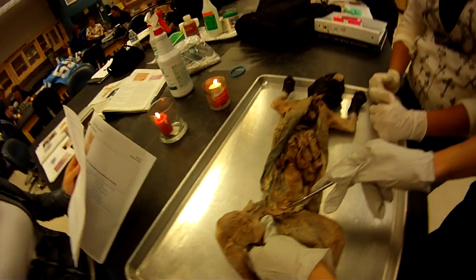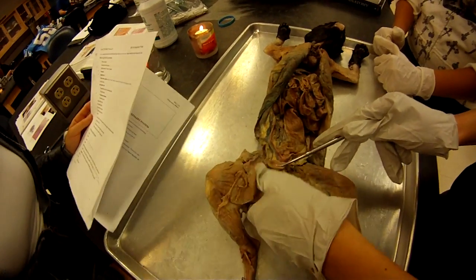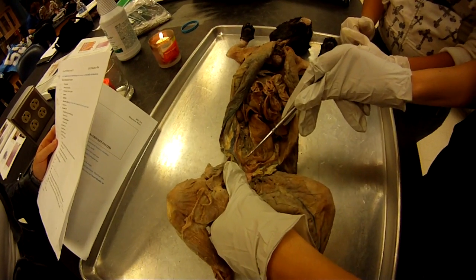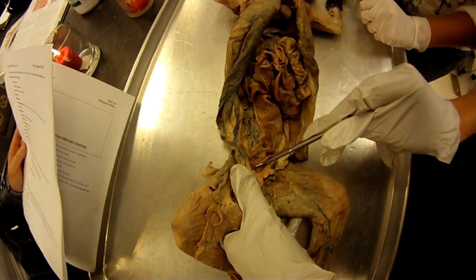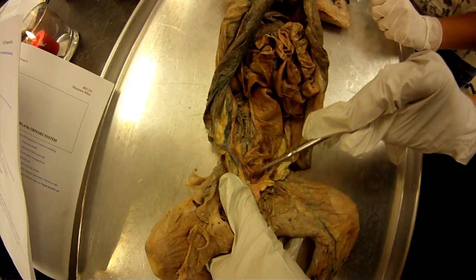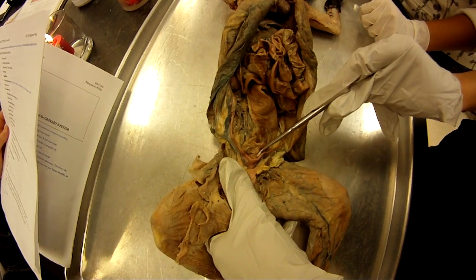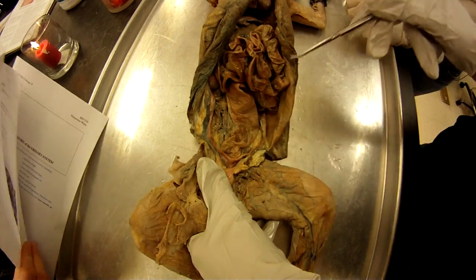Start with the bladder — here's the bladder. The uterus is right here, this is the body of the uterus. These are the horns of the uterus; you have your right and your left.